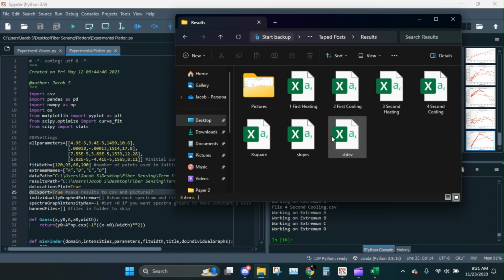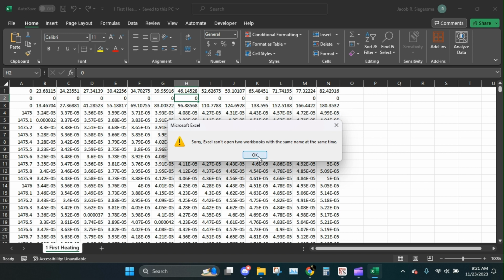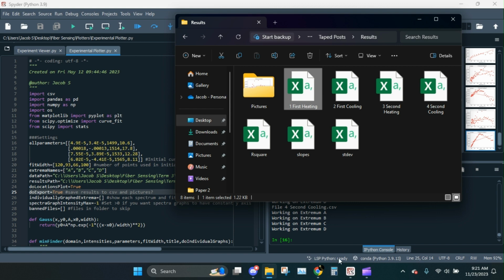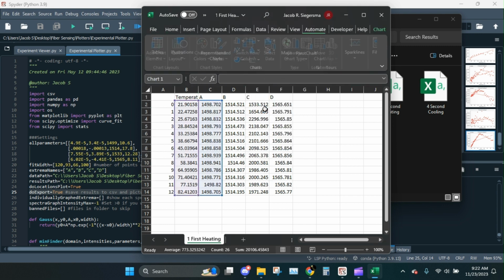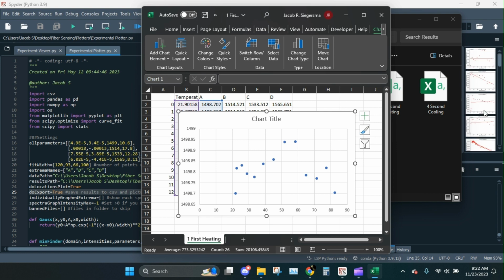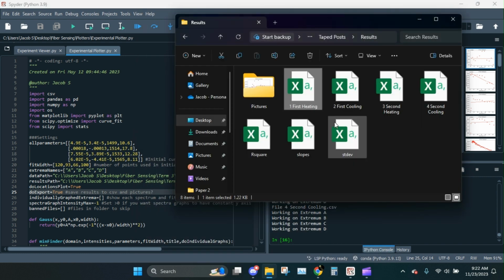Okay, you see we generated a couple different CSVs here. These first ones, like I'll open up first heating here. Can't open the same thing at the same time. Okay, that's a good point. Closed the other one, I think. There we go. So here we could see for the first heating, for each temperature, where each peak was located, right? So if you want all of just the raw data, you could turn these into the graphs. For example, scatter plot, boom. And that should match this one. See? So that's that. I'm not going to save. So all of those are the same. It's just the points over temperature.